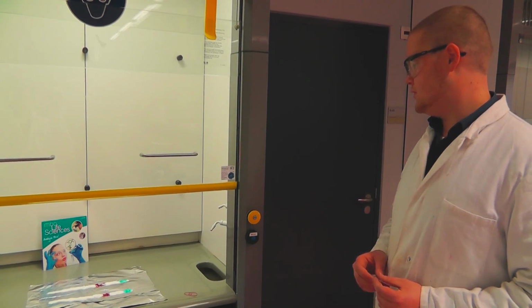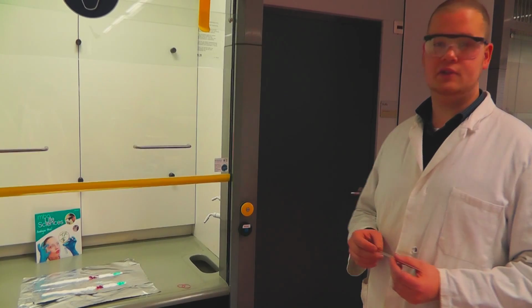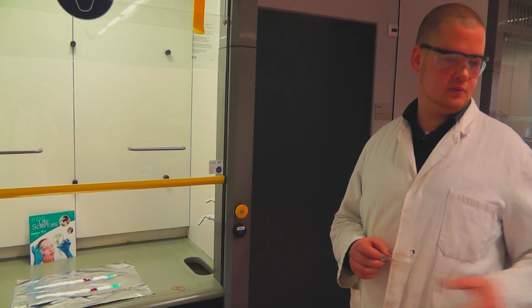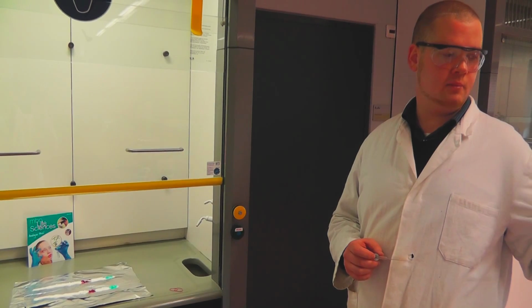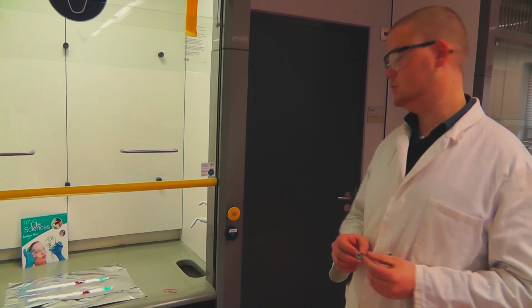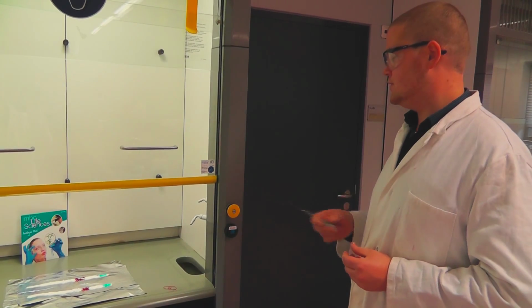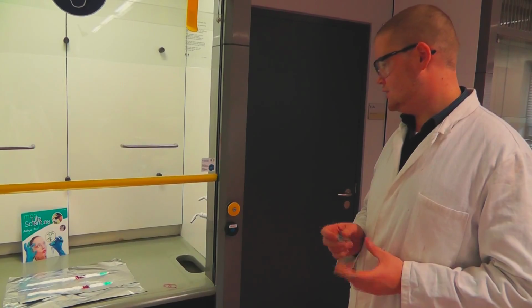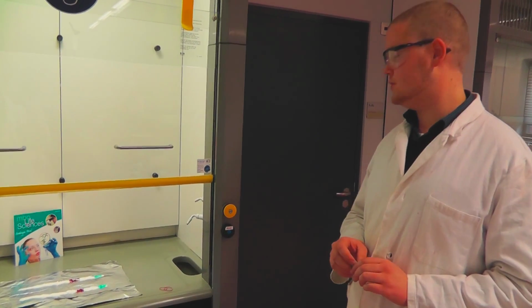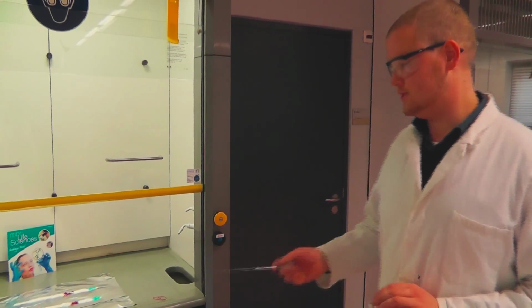In addition, we've also placed some salts on the mixture, and they will be alternating. There are some sodium salts, barium salts, cobalt, and copper. So we will see some color changes as the flame progresses throughout the line, and it's a cool reaction to demonstrate a redox reaction, but it's also just fun to do. So let's watch.